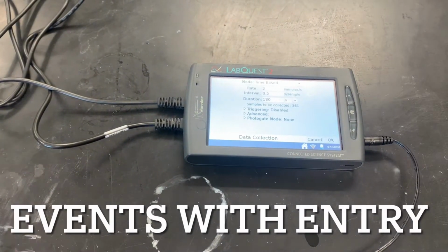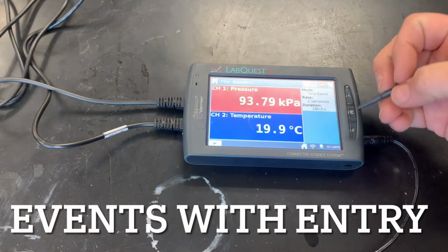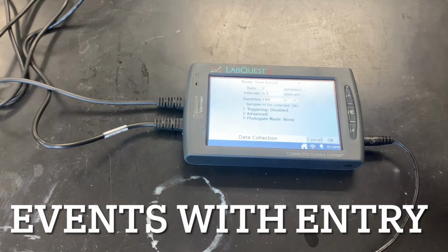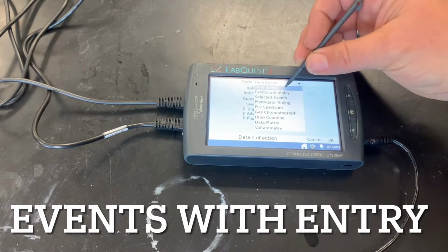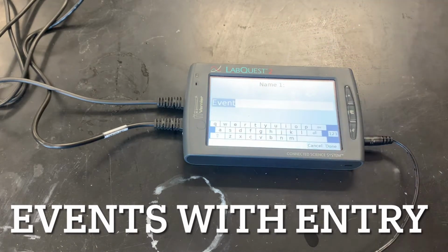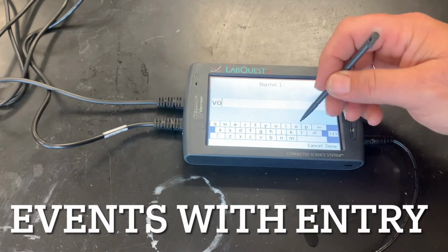Okay, so when you need events with entry, you simply, let me back up to the home screen. You simply can click right here, and you are going to click here and say events with entry. You need to change your event to whatever it is. Most of the time we use volume.